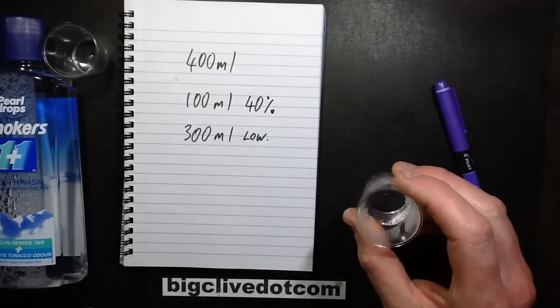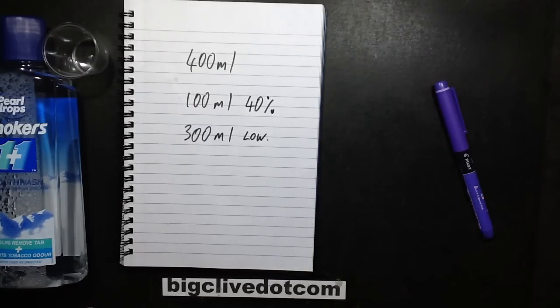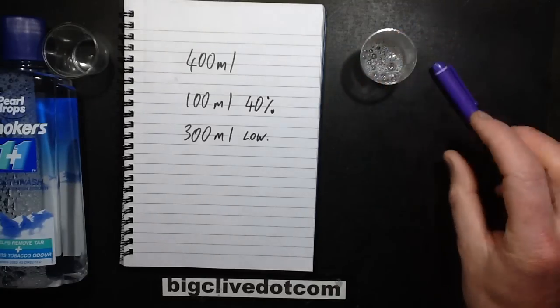So what's left? What's in this, what's the remainder? It just tastes like sugary water.